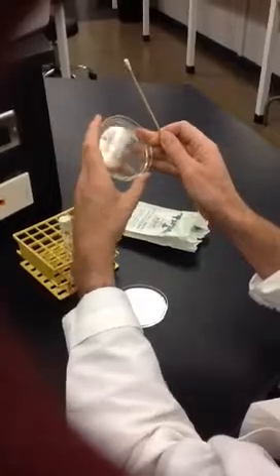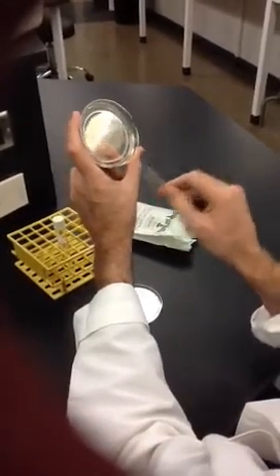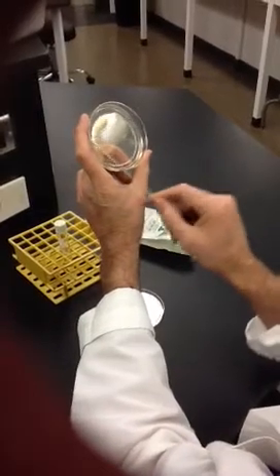When you've completed that, turn it 120 degrees and again start across the middle, working your way back and forth up to the top.